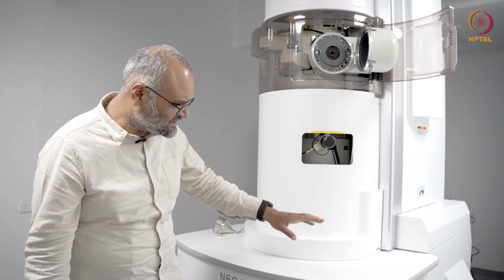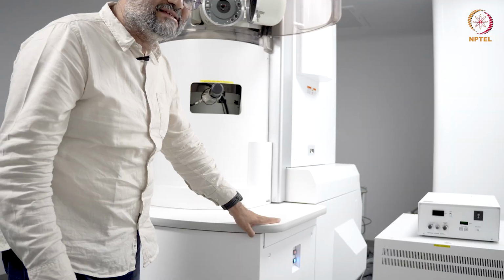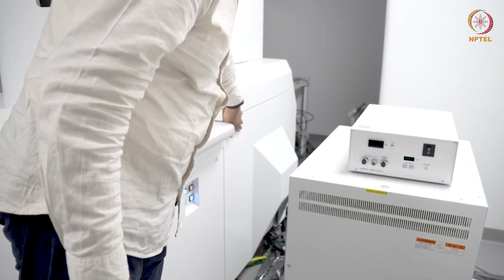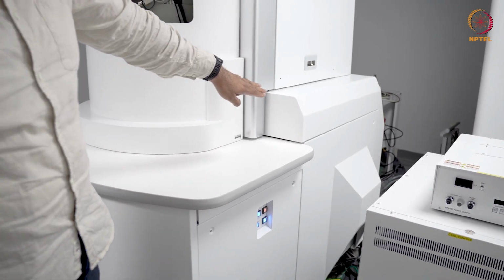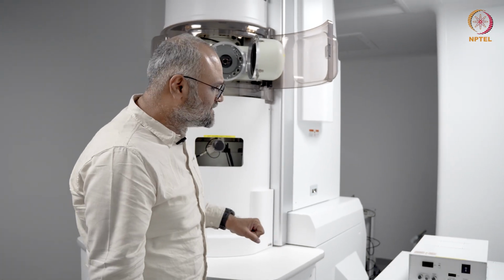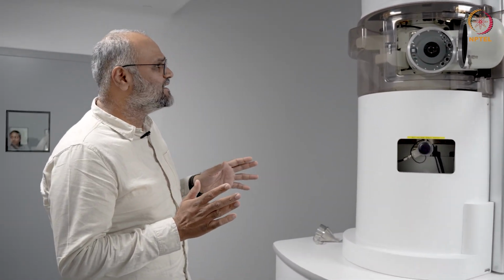And if I go down here, this is where your detection system is. You cannot see it, it is all concealed, but if we come to the side, somewhere in this location, below the microscope column, you have a camera. In this particular microscope, we have the Gatan Rio camera. We'll look at various components of the microscope again, and we'll start looking at the interface and the layout of the control console, and we'll understand how to start operating this instrument very shortly.